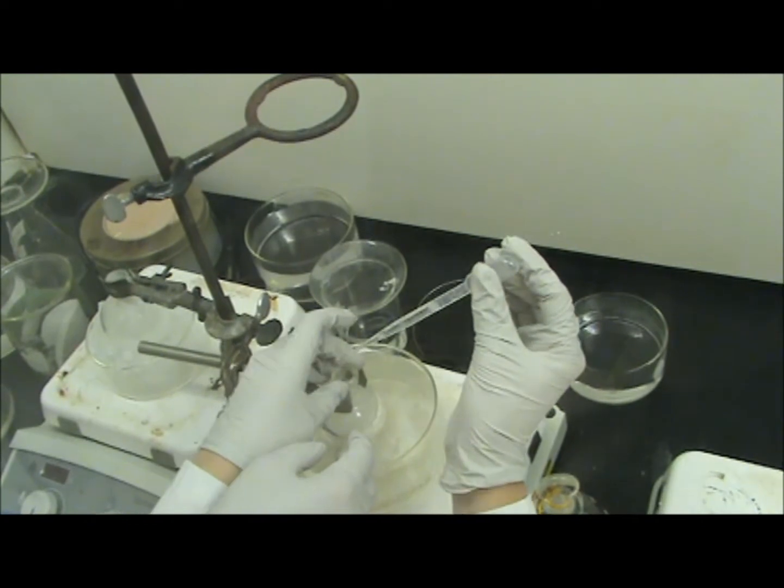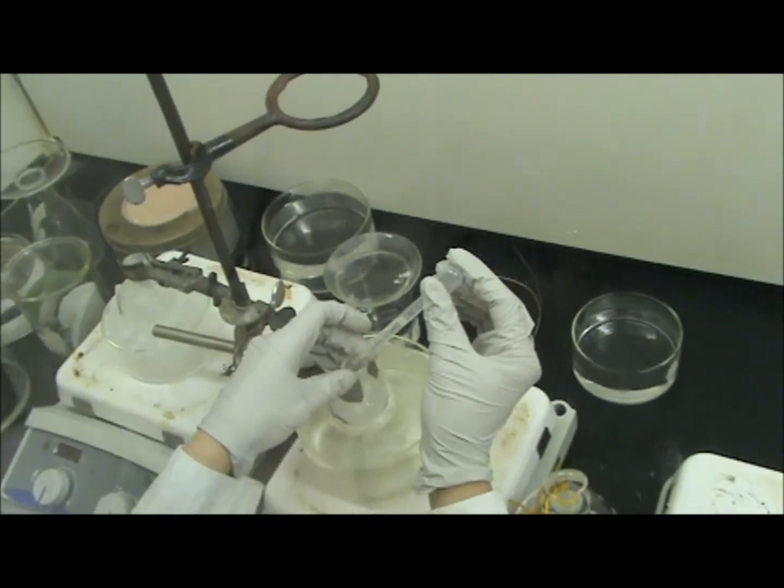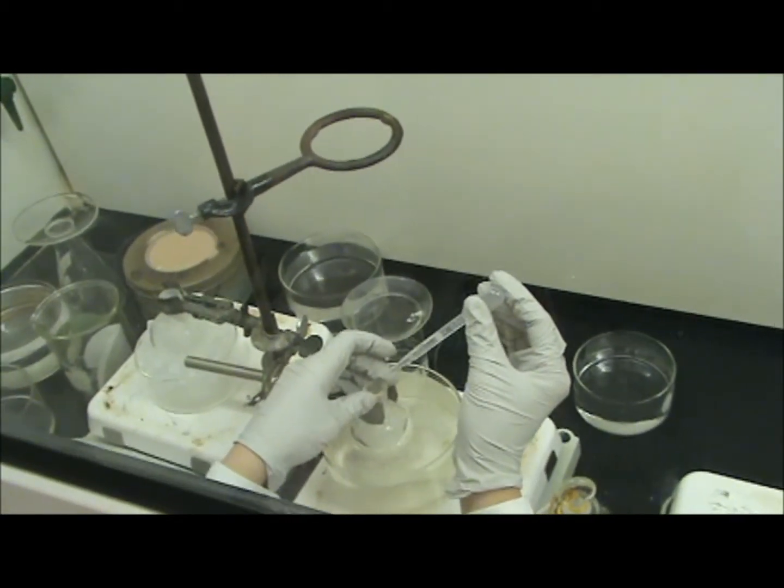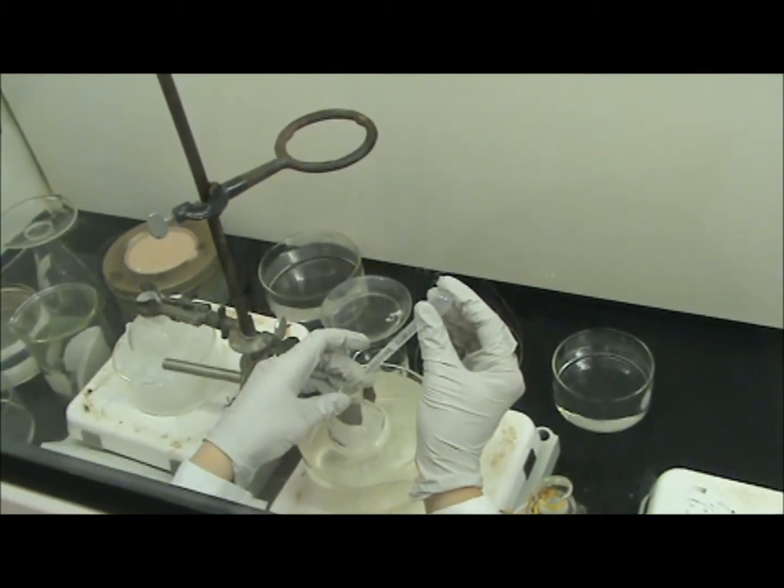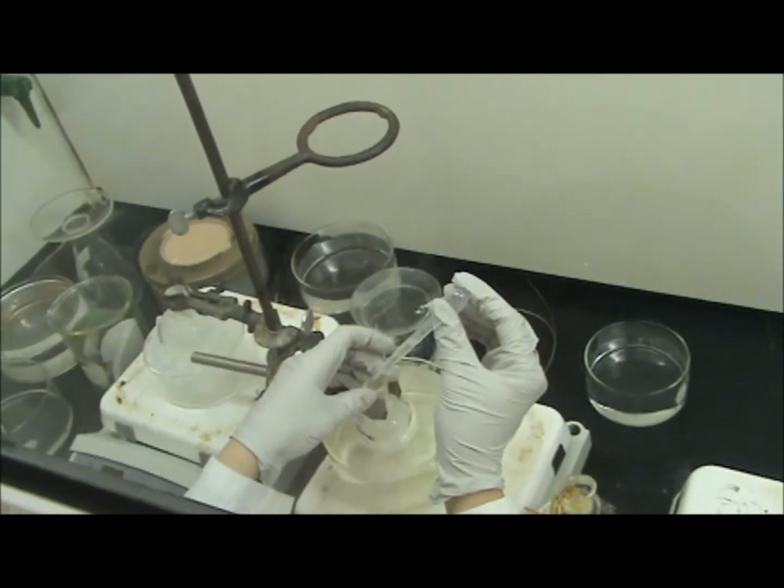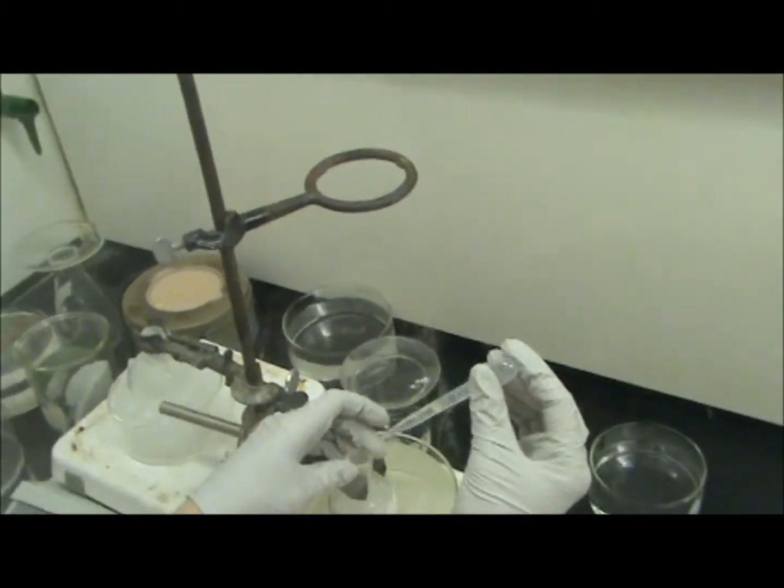We are adding ethanolic HCl to 6 molar to our now reduced, what's that called? Glutarimoride? Glutarimide, I guess. Yeah, and some gas is coming off, and it's cool. It's chemistry.